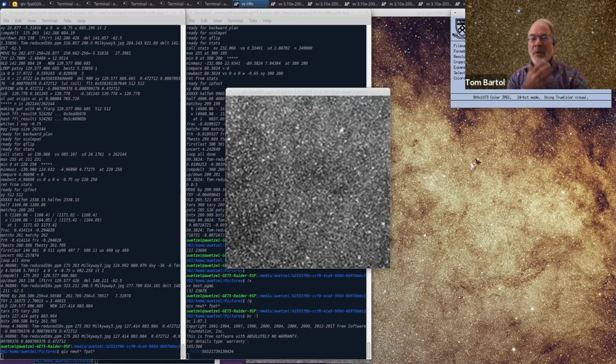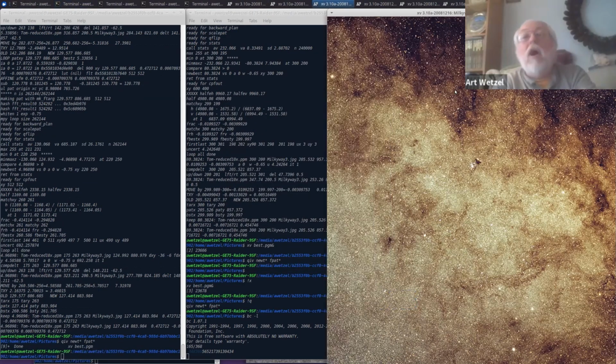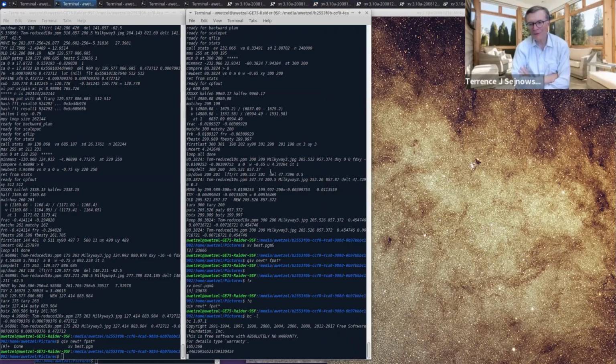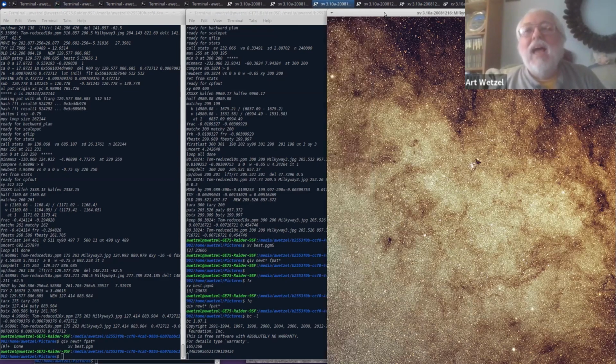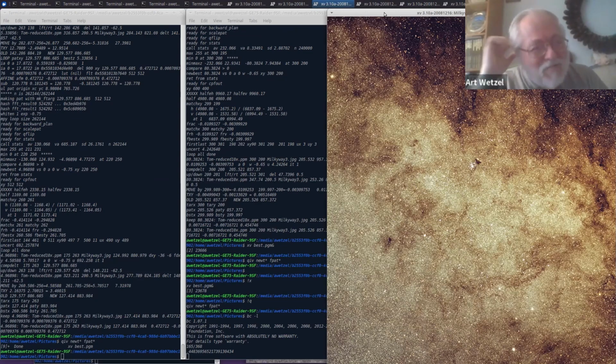Yeah, this is great. So we can actually see how you do this from the command line. And so Tom calls these same programs unchanged and picks up the information that comes back in text form, and then applies that to what you all see through the GUI, the graphical interface. And so we could just as well do that on star fields as we do with your electron microscopy images. It's the same mathematical procedure underneath. XV is as ancient as VI. Just about. And I use them both all the time. They are my mainstays.